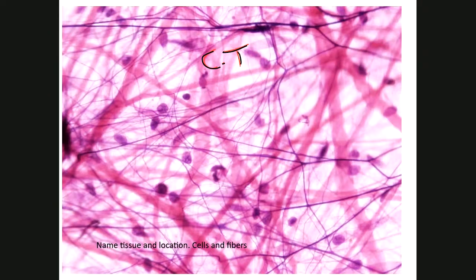Loose connective tissue proper, we have three choices: areolar, adipose, and reticular. Adipose tissue is the one that looks like empty blobs of cells. That's not what this looks like. That leaves us with two: reticular and areolar. Now, reticular connective tissue had essentially what kind of fiber? That was reticular fiber. What we see here is more than one kind of fiber. We see thick fibers. We see thin red fibers. We see these purplish black fibers. We see all three types of fibers. That leaves you with really just one possibility. This is areolar connective tissue.